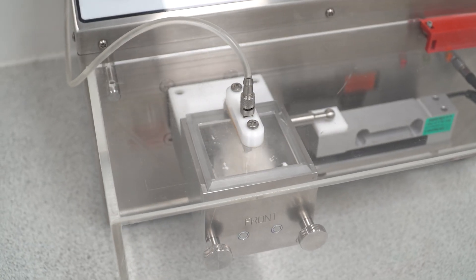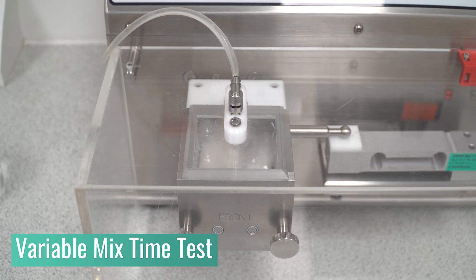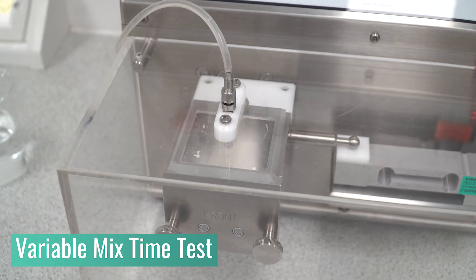Once you have the optimum binder ratio, you can now find the optimum mixing time for your formulation by utilising the MTR's variable mix time test.